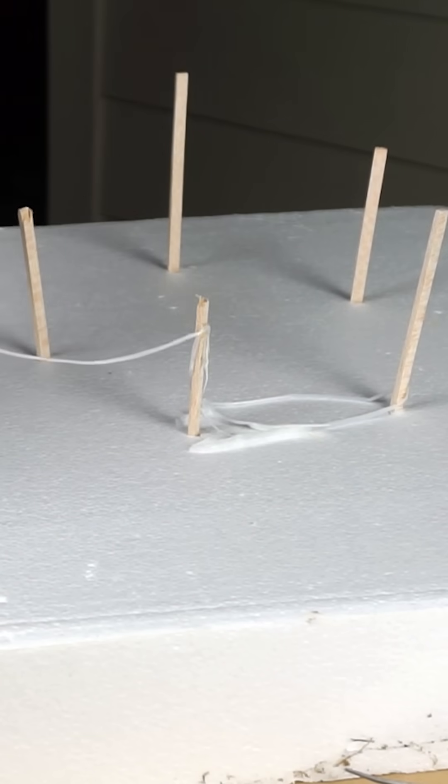This looks an awful lot like Spider-Man's web now. So let's string it out and see how long of a rope we can get from these two liquids and see if I can make a spider web out of it. Yeah, it just keeps coming.